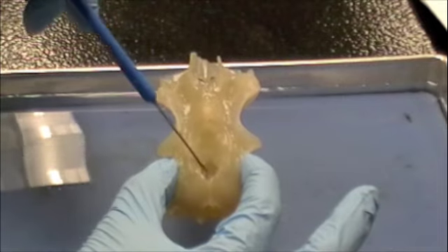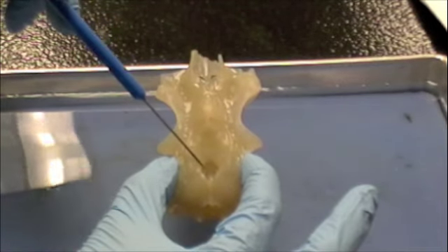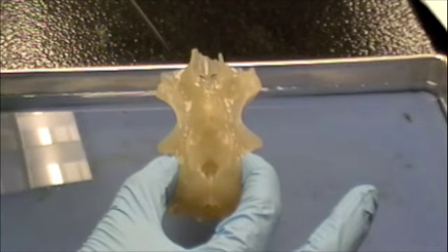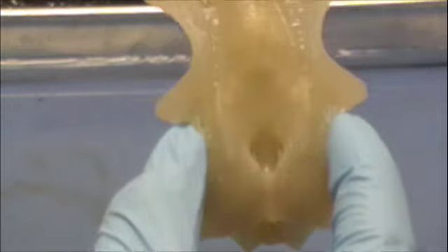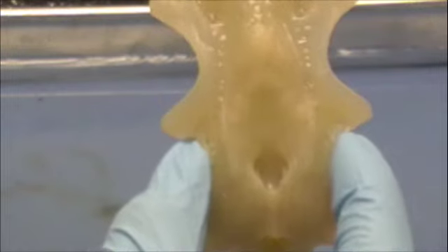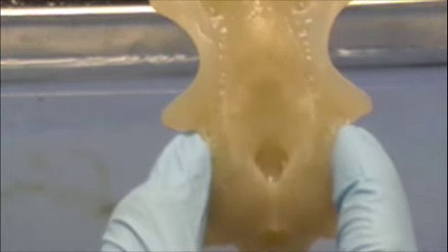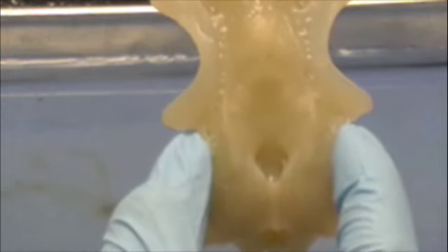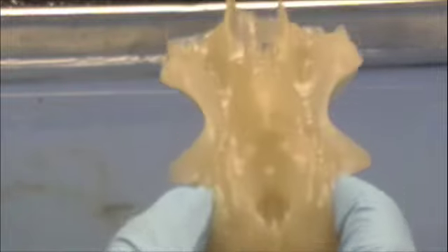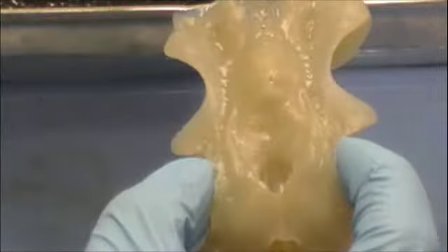That hole is the endolymphatic fossa. I'm going to zoom in on that — go ahead and lift it up a little bit. Then the occipital. The otic capsule — I might need to find it. That's on the bottom.